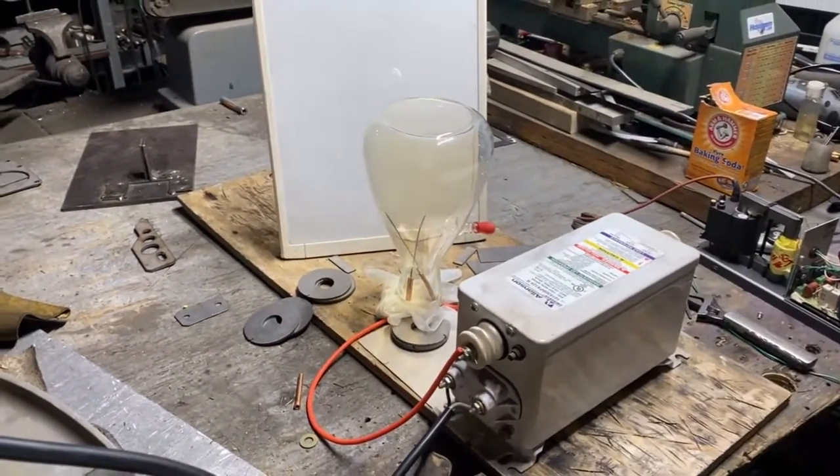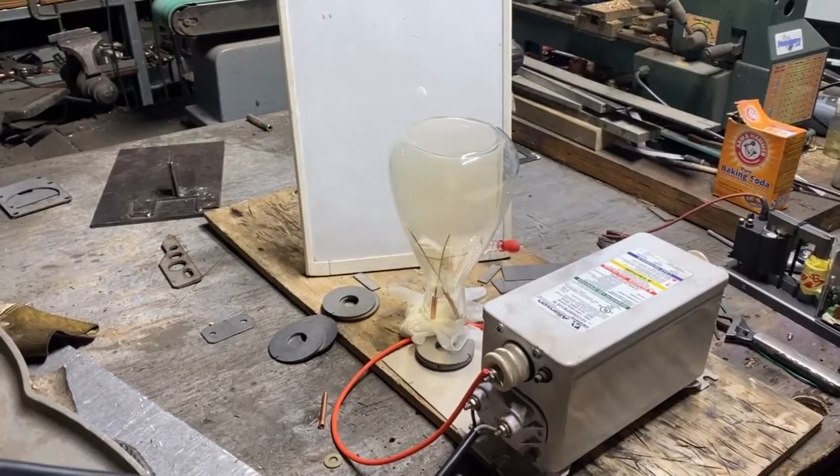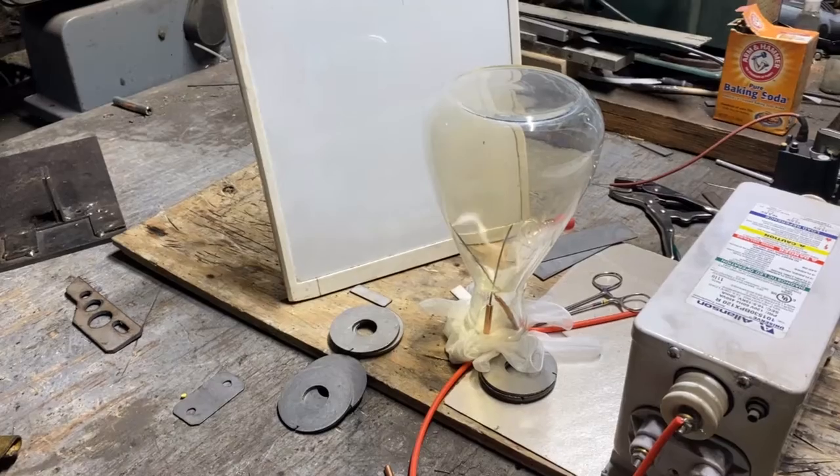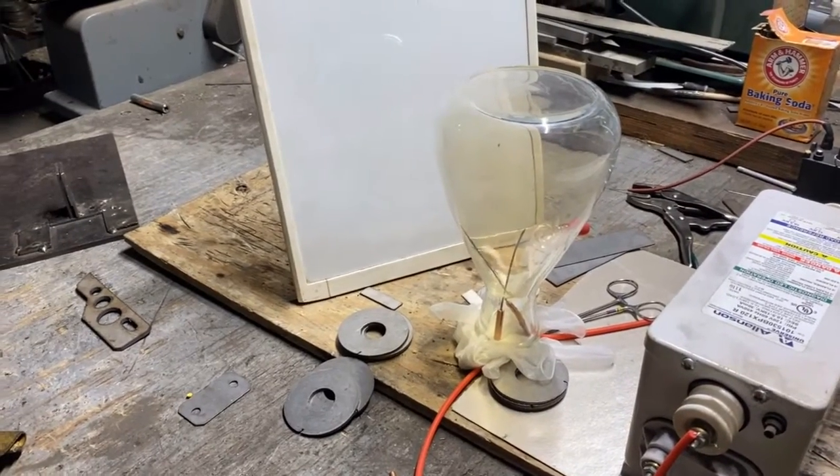This gas will not get brown no matter how long you let this run — you can see it's barely brown in there, and it's been running for an hour. Look how big the spark is compared to the last run for an hour on the little spark.